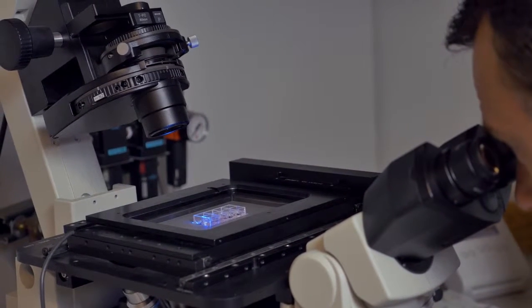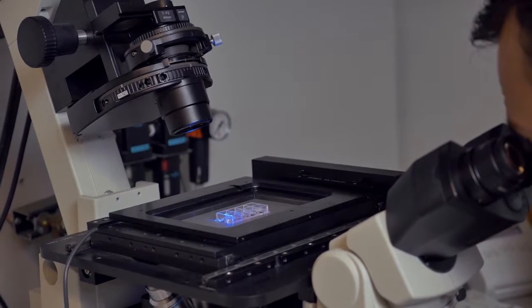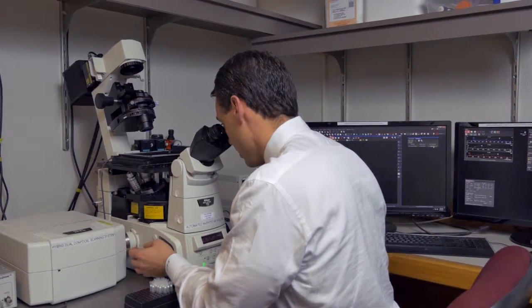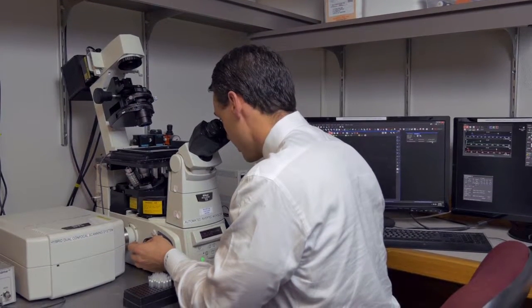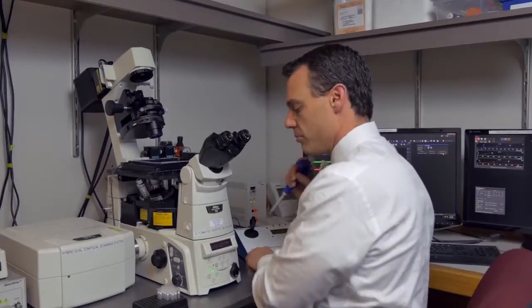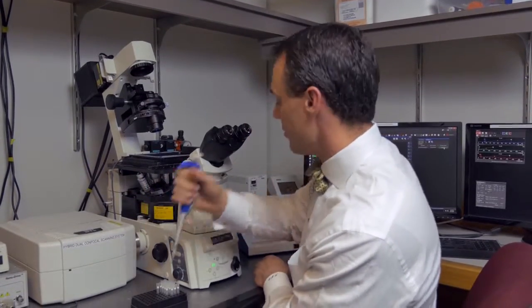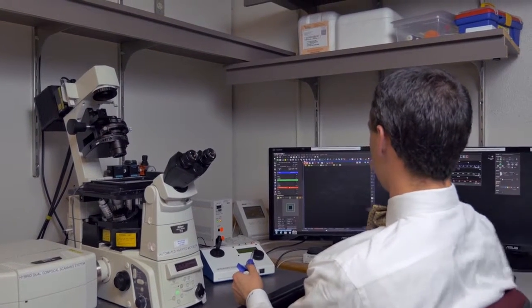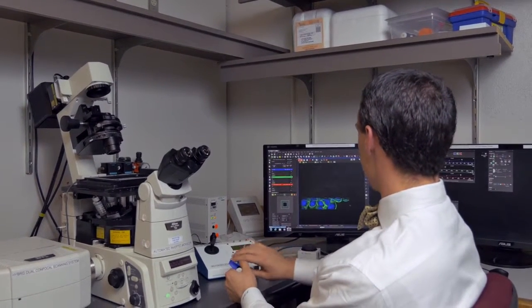What I'm actually looking at are human endothelial cells. These cells are routinely used in the biomedical space for determining numerous applications. So what I'm doing is I'm actually adding a little bit of basil oil. I'll transfer the image now over to the microscope here so that you can see them.